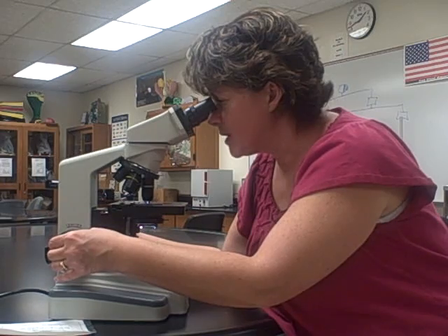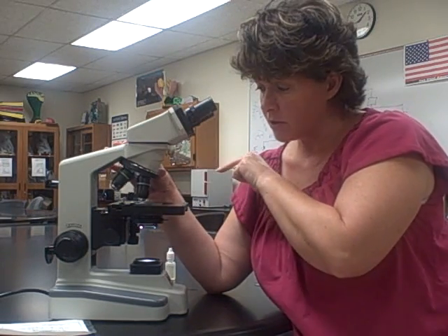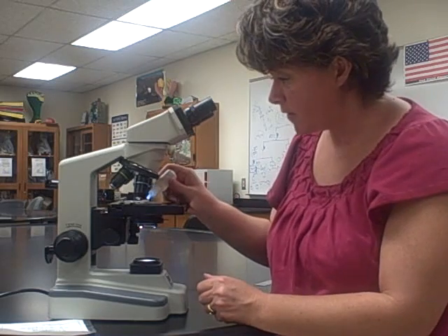Now I'm ready to use the oil immersion. Keep in mind that once you put the oil on, you cannot go back to the 40x objective. So be completely confident that you have a good specimen in focus and centered before going to the 100x objective, because you have to put the oil on and we can't get oil on the 40x. You position the slide so the specimen is between the 40x and the 100x.